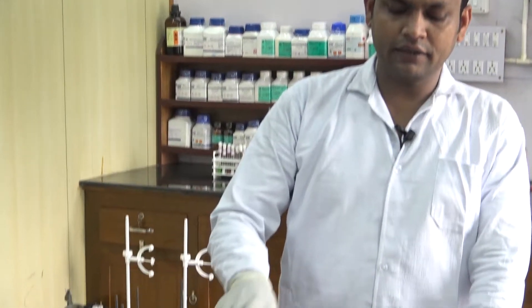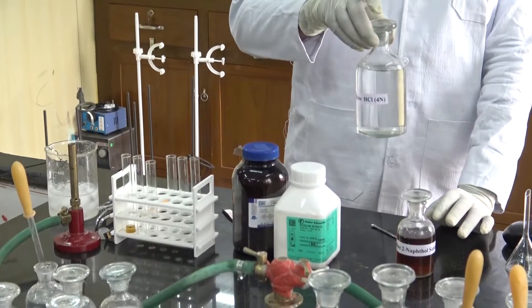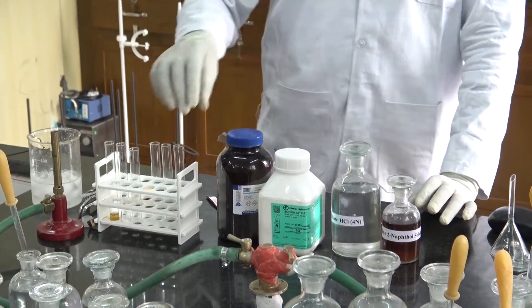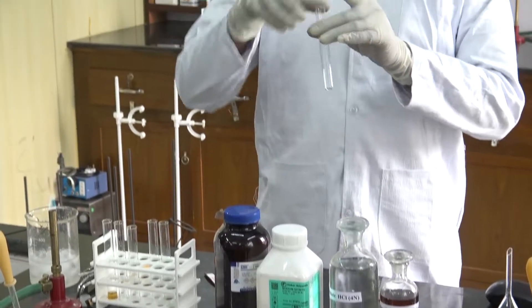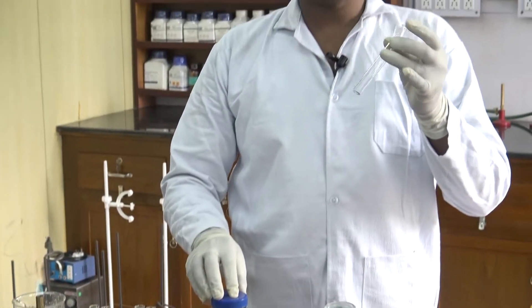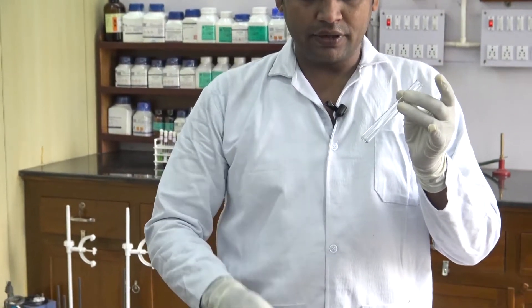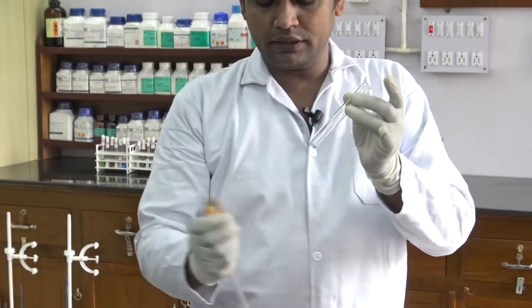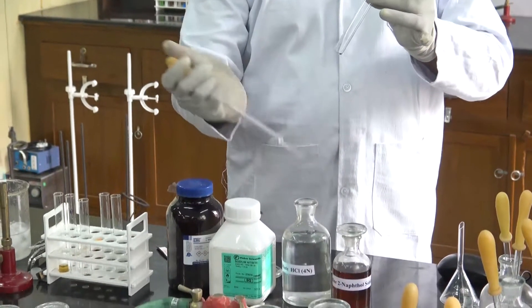First of all, we test the solubility of amine. For this reaction, we need the sample and dilute HCl solution. At first, we take the sample in a test tube, then add dilute HCl into it.